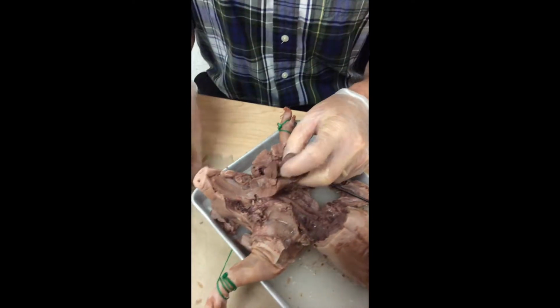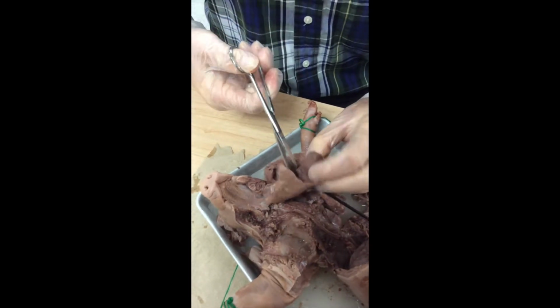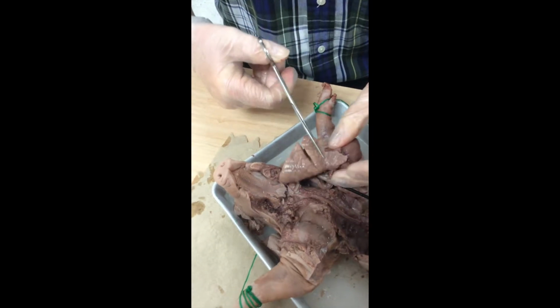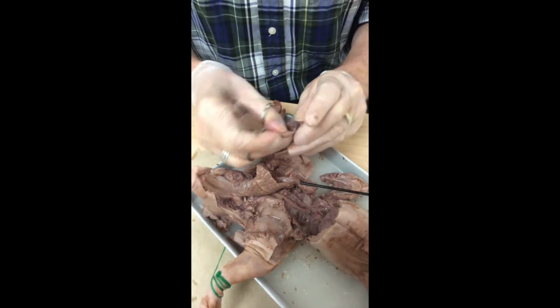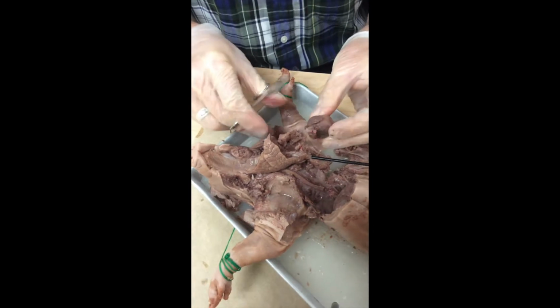And we're going to go ahead and get the heart out of there. I want you to take some time, not too long, but a little bit of time, to look inside the heart. So you just cut that out of there. And a couple of things I would point out to you on the heart. I'm going to get that thymus gland off there so we get a better look. Take the rest of the pericardial sac off of there.